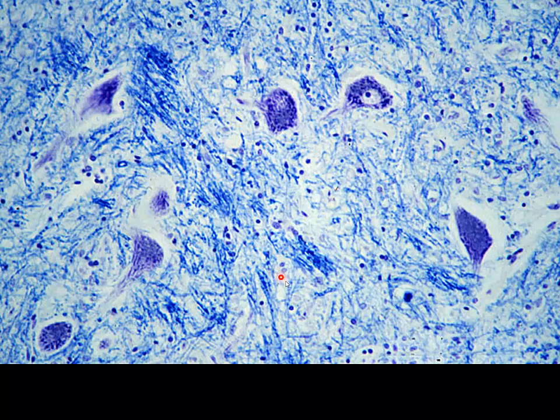This look, where you see a lot of space and a lot of fibers, is just kind of generically referred to as neuropil. So this is Nissl on the inside, and this is neuropil on the outside. Remember our term ground substance kind of was stuff. Well, neuropil is a generic term that means neuronal stuff.